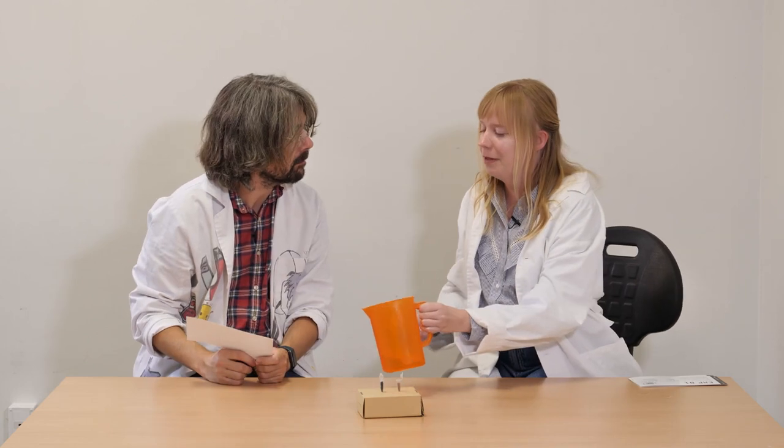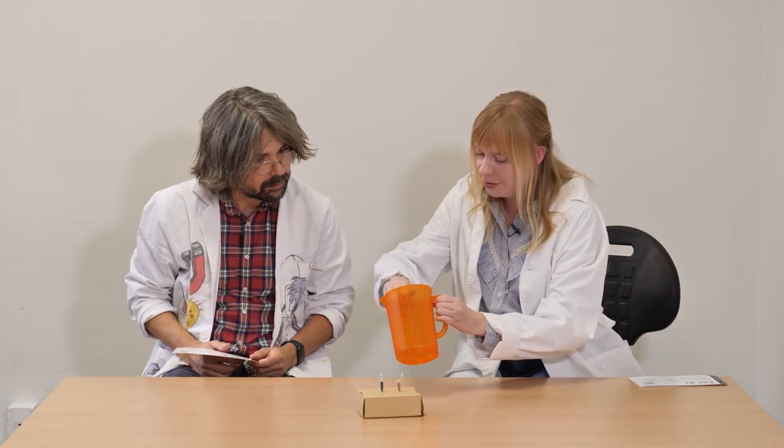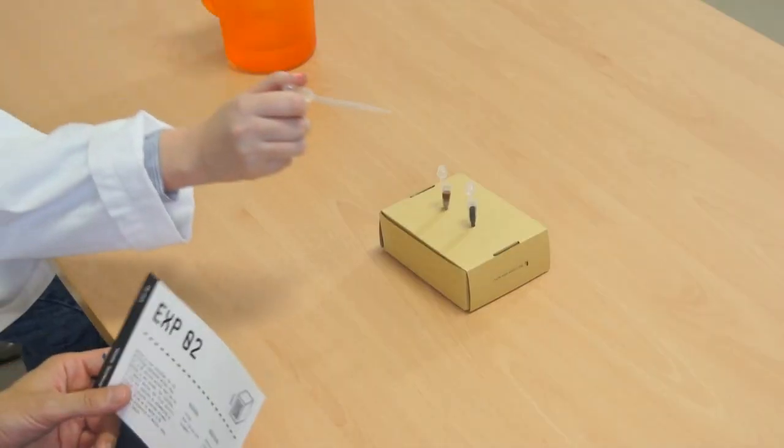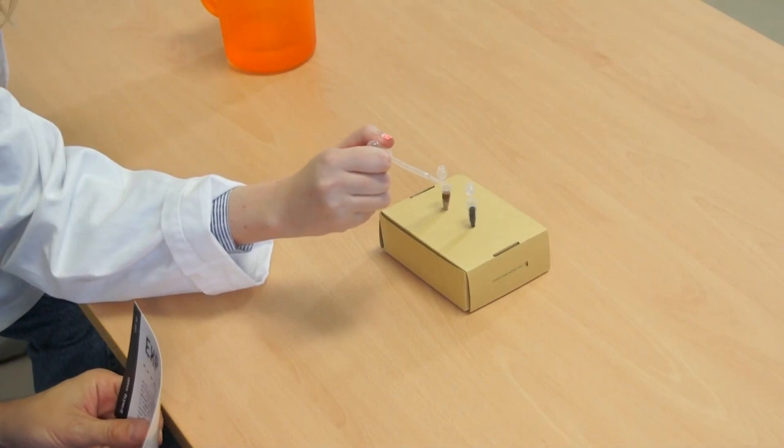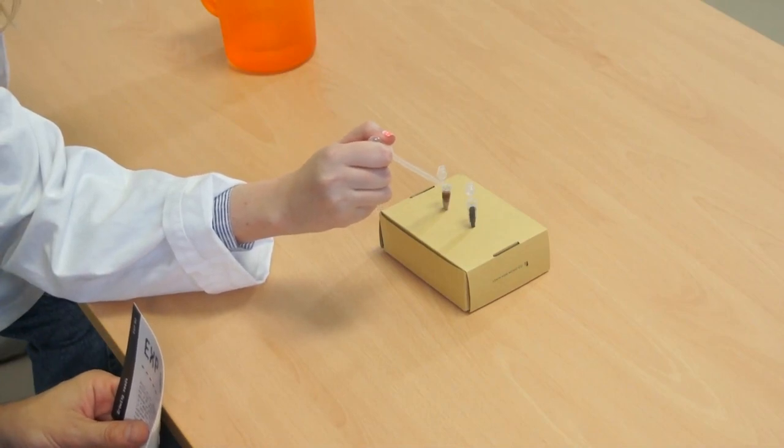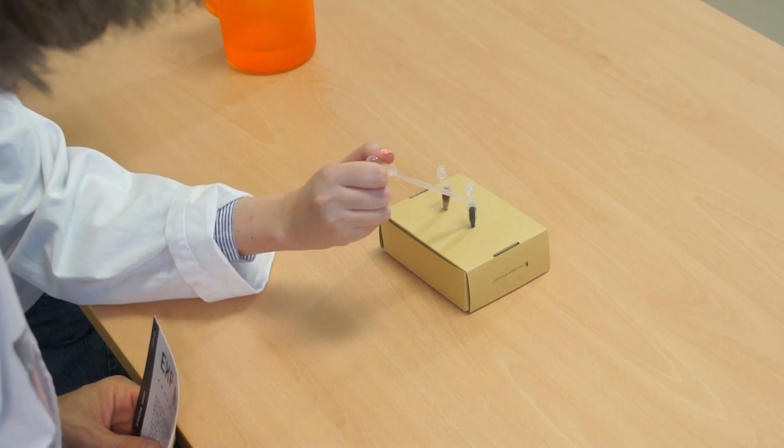So when you're using the pipette, first press it and then put it to the water and release so it fills with water. Take it out and put a few drops of water to each, the same amount.